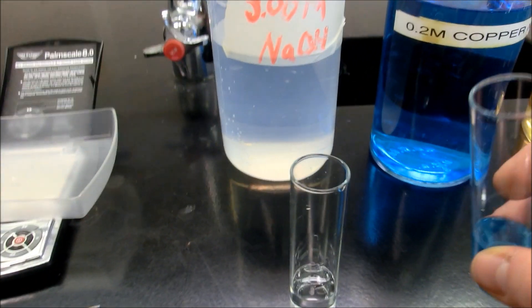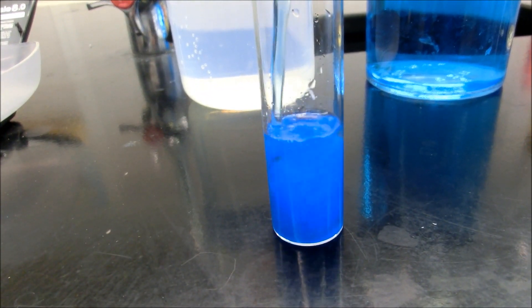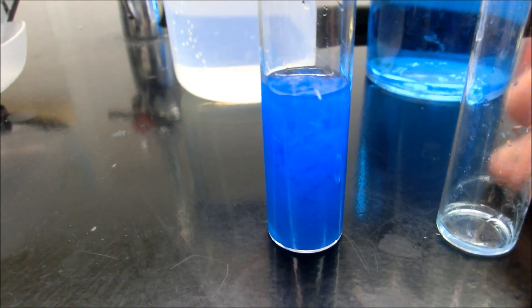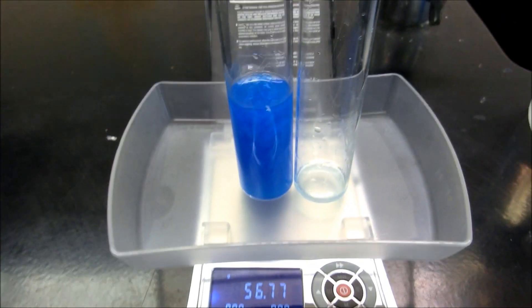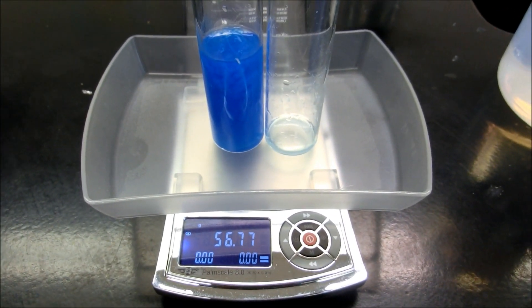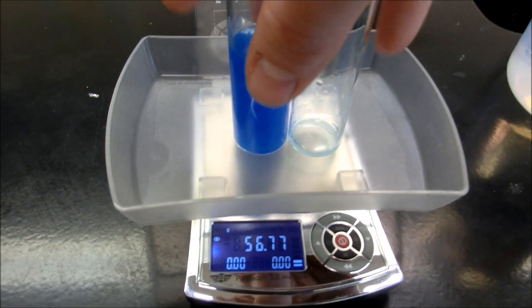Pulling those off and combining the two. You'll notice that there's a solid blue-like gel on the inside. I'm going to put that back onto the balance. And we have 56.77 grams. Pulling those two off. Next reaction.